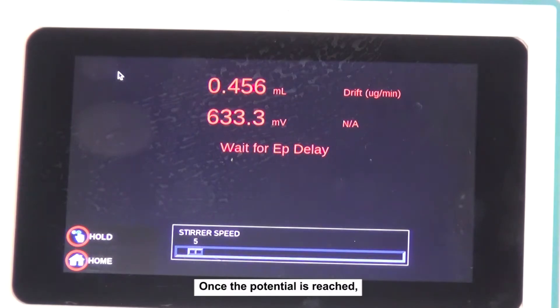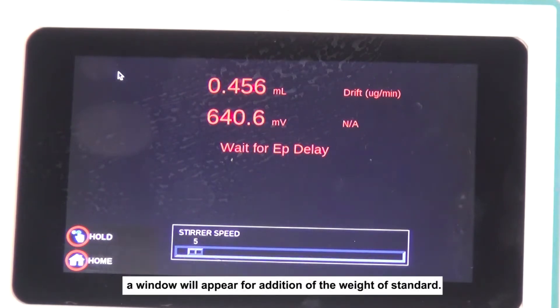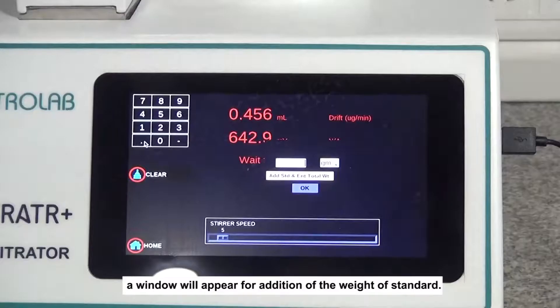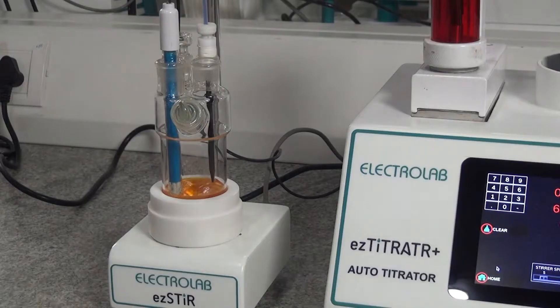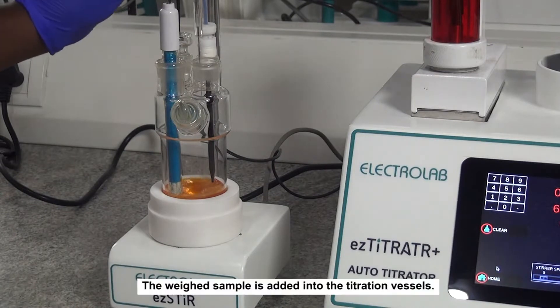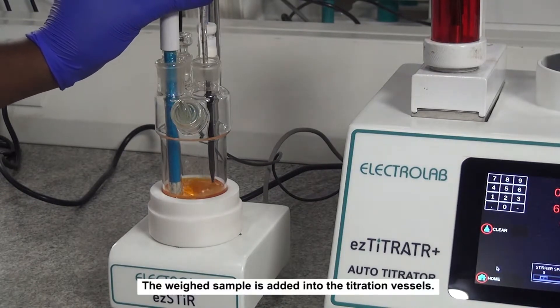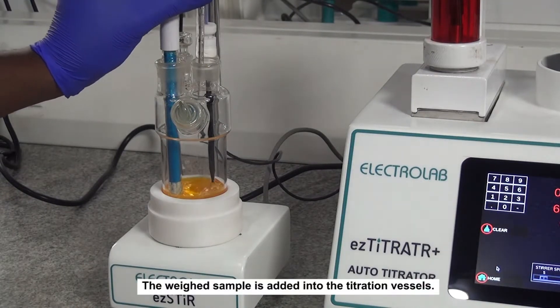Once the potential is reached, a window will appear for addition of the weight of standard. The weighted sample is added to the titration vessel.